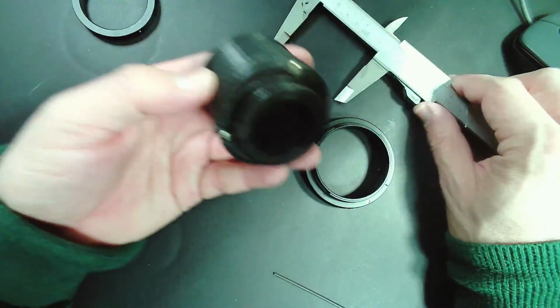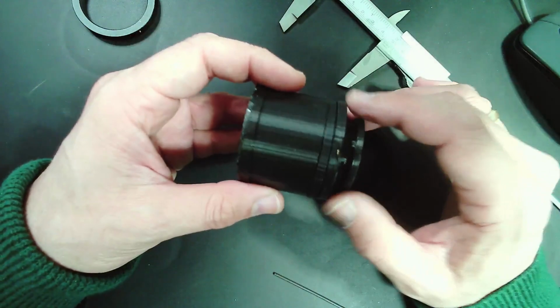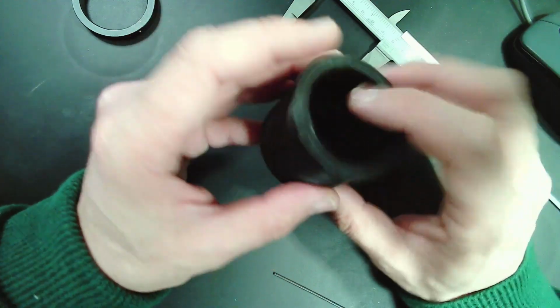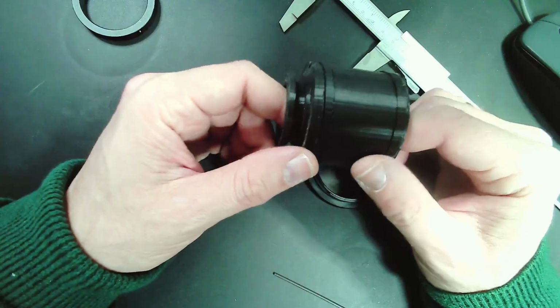So that's basically the solution that I recommend. And if you have some kind of a CNC machine, then you might actually make this out of aluminum in one piece. And I think that maybe might look even a little bit better. But then again, I mean, it works quite well.